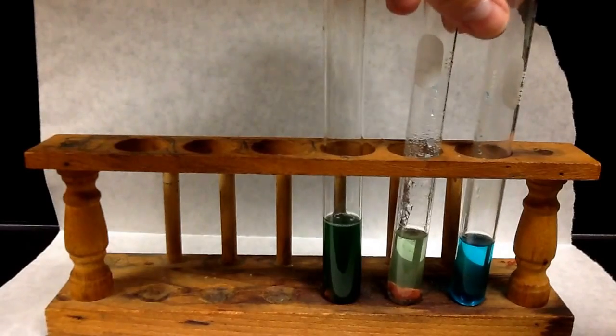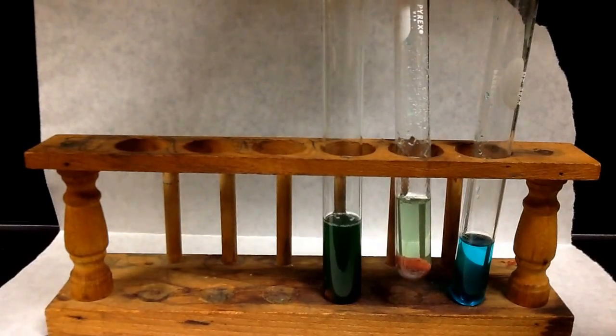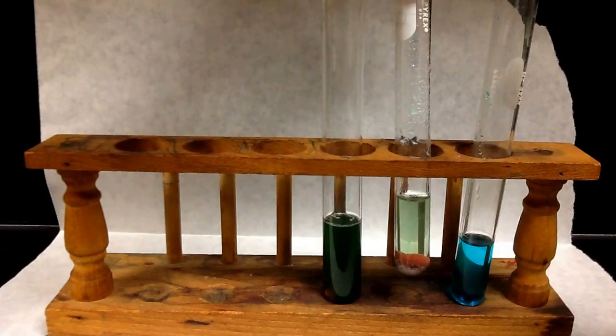So we definitely know a chemical change happened here. We have a change in the color and the appearance of that particular solid.